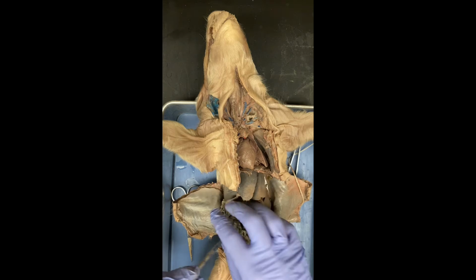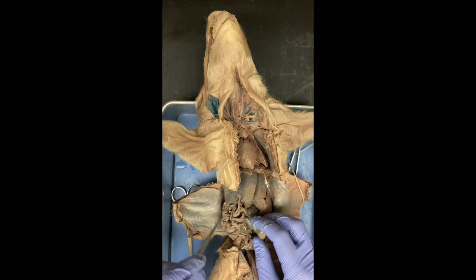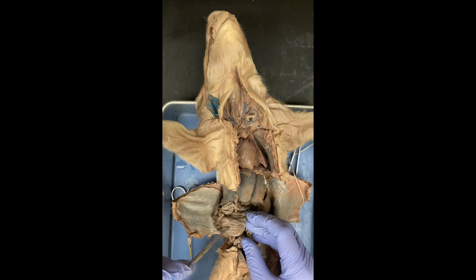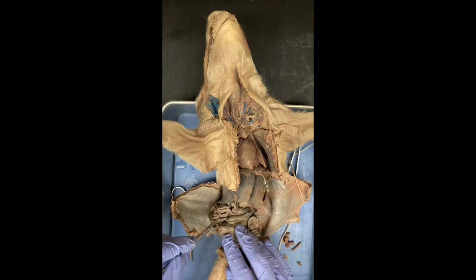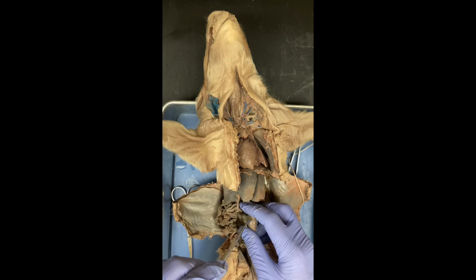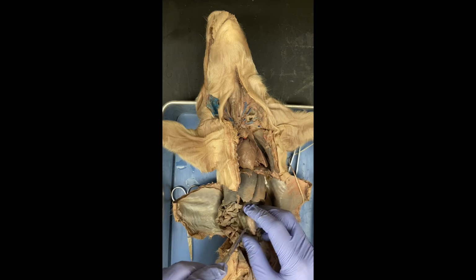And while the small intestine was used to absorb nutrients, and it's a very long quantity, it takes a while to absorb nutrients, the large intestine is slightly shorter, and it's a thicker tube, and it mostly absorbs water and some nutrients still. So that's the large intestine.